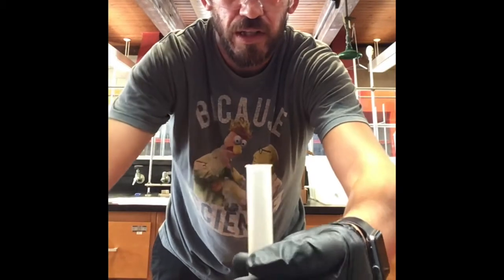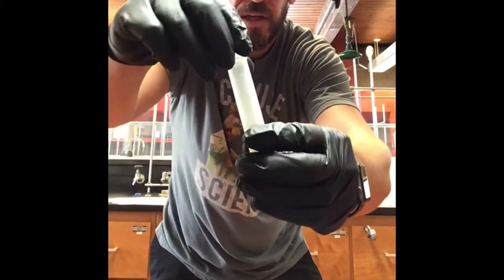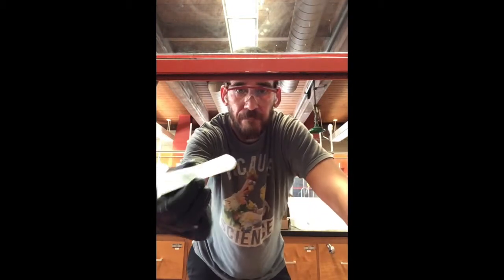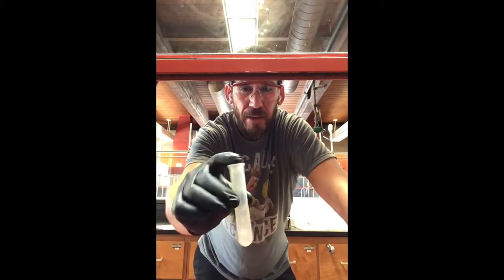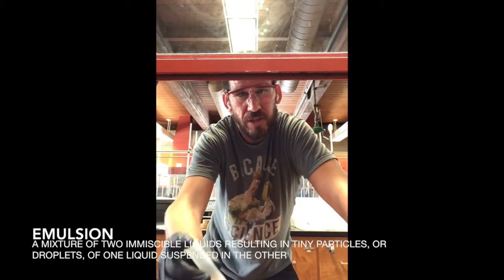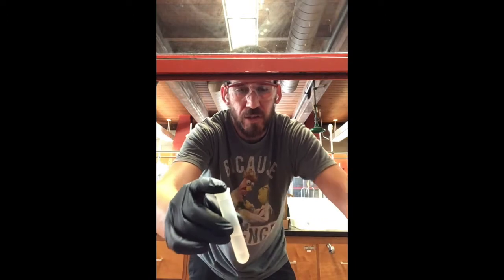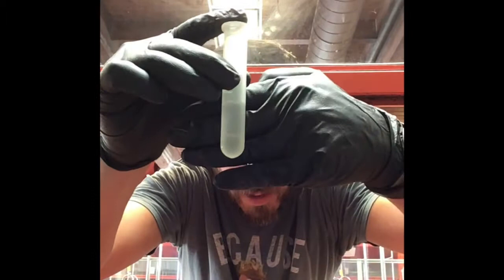So now what I want to do is cap the centrifuge tube. And I'm going to want to invert this a few times. It's basically shaking. I don't want to shake too vigorously because what's going to form is an emulsion. And that emulsion takes time to kind of go away and separate into the 2 layers that the methylene chloride and the water usually do. And so it's like oil and water. You can kind of see the 2 layers.